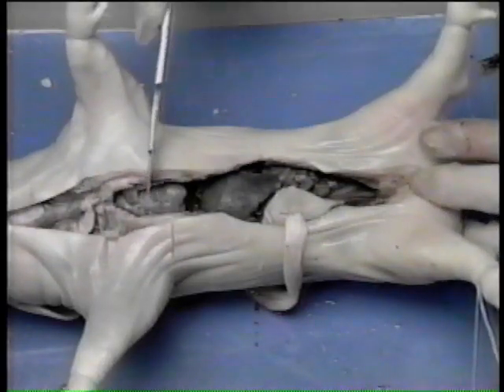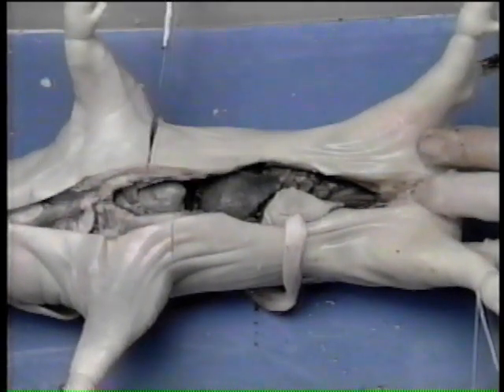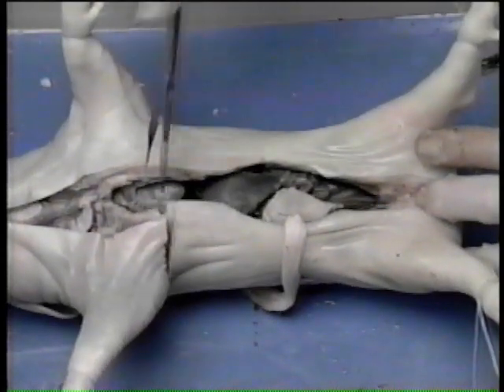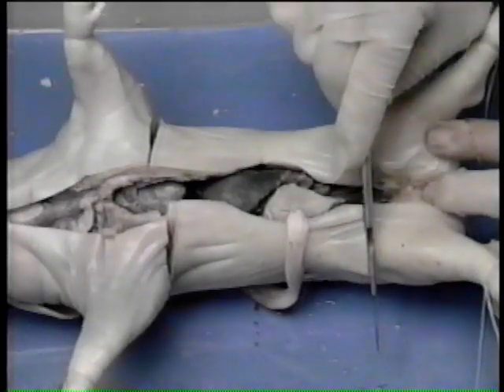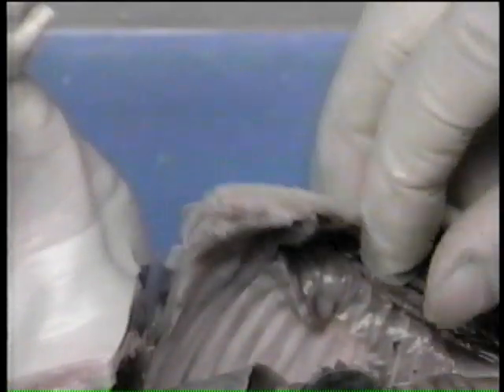In order to make lateral flaps, cut into and through the body wall just caudal to the forelegs and just anterior to the hind legs. Pin the flaps down, out of the way.